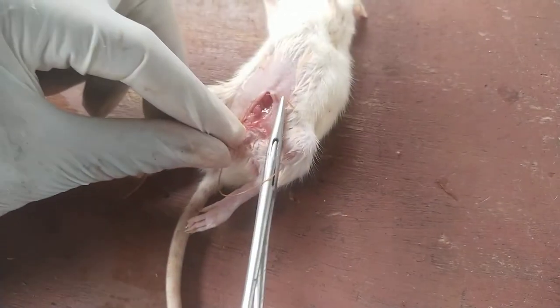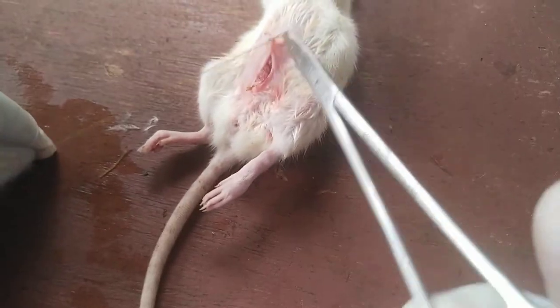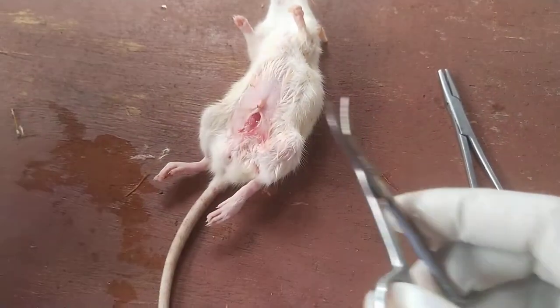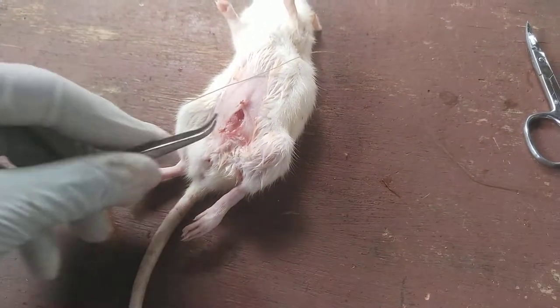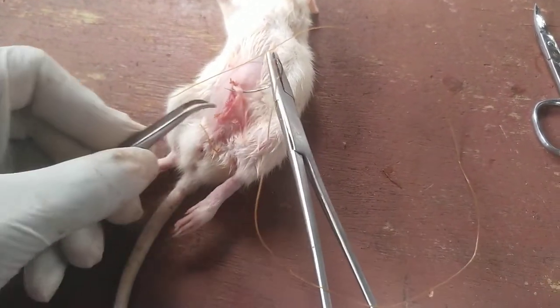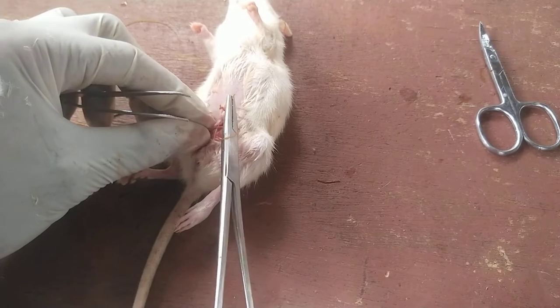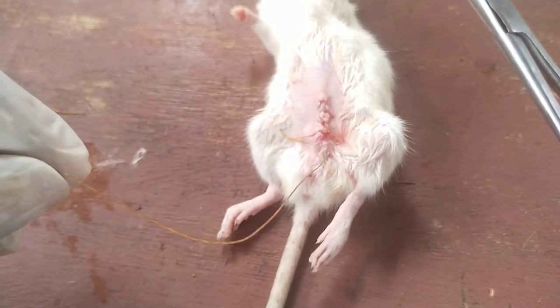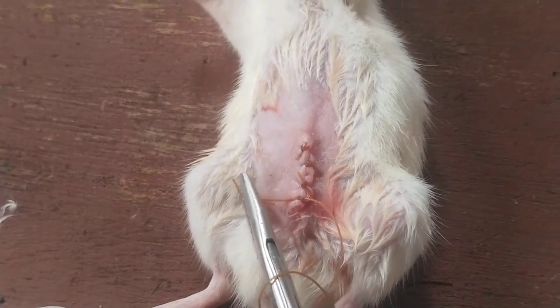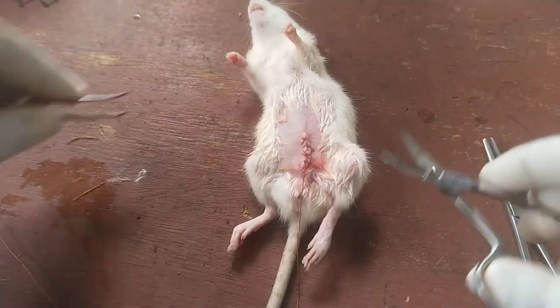For the skin, we do a simple interrupted suture, whereby we suture each part and cut, then suture again and cut — continuing this way across the incision.